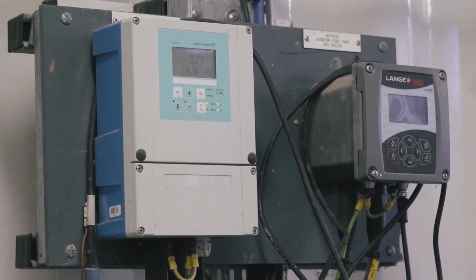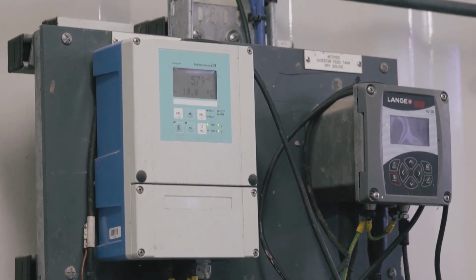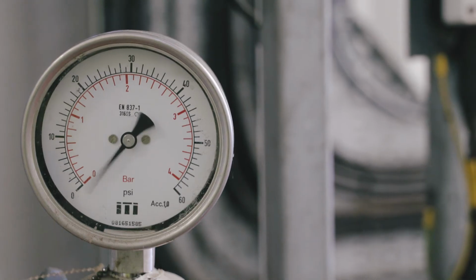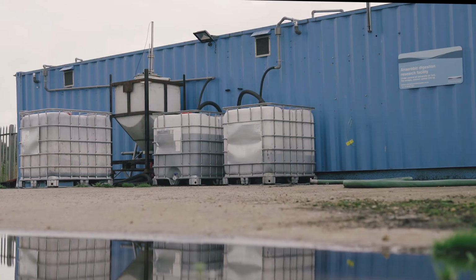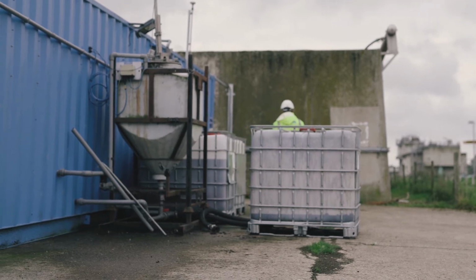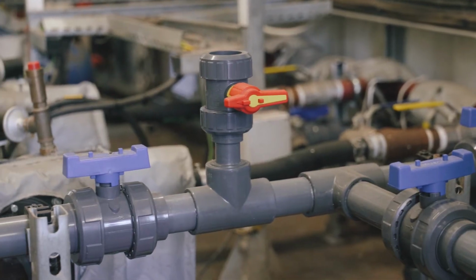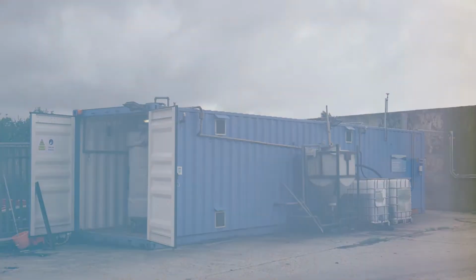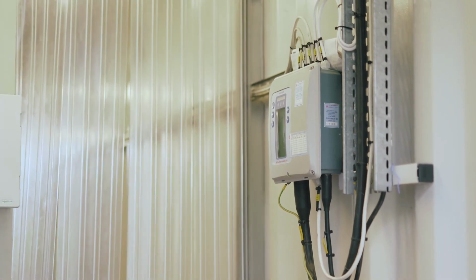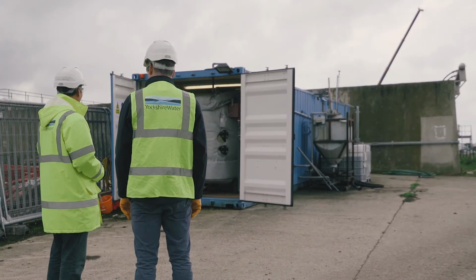pH meters, and we have a pair of systems so that we can intervene with one and keep the other, say, as a normal site control, so that we can see what's going on. All the data that we collect, so in terms of temperatures of the vessels, when they're being stirred, how they're being fed, all that kind of stuff goes to the Yorkshire Water standard telemetry system, so all the data from the rig is sent off-site onto Yorkshire Water servers.